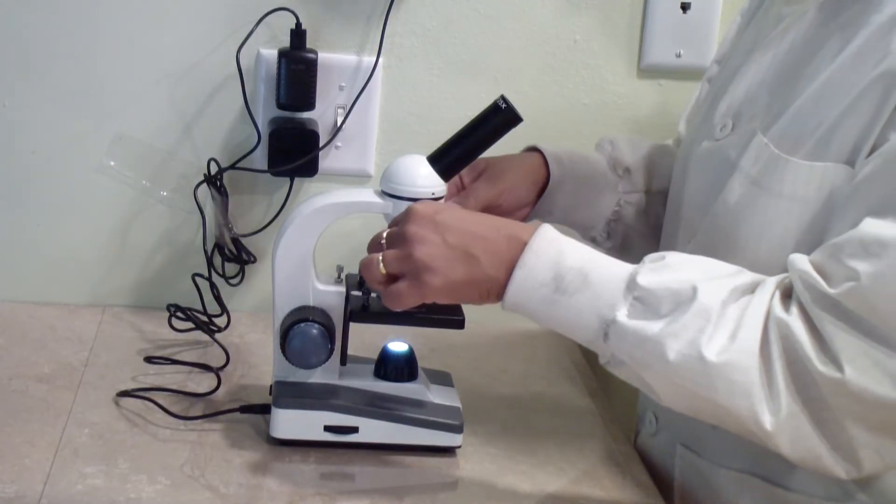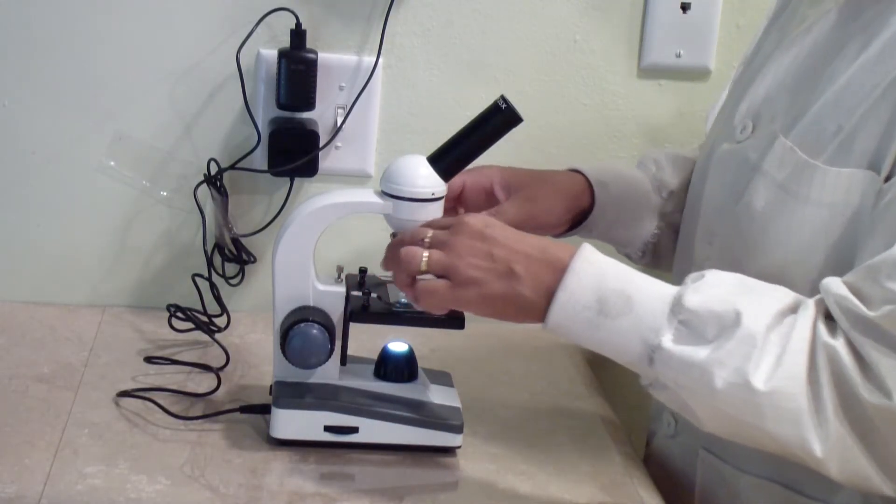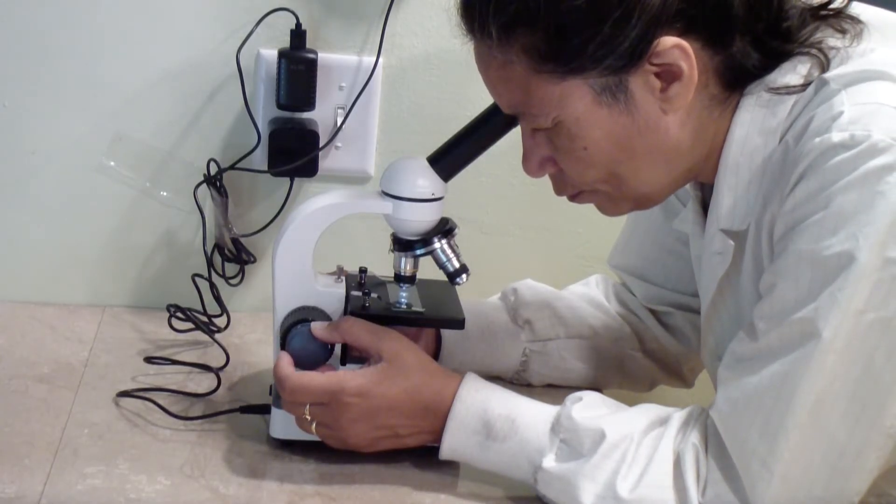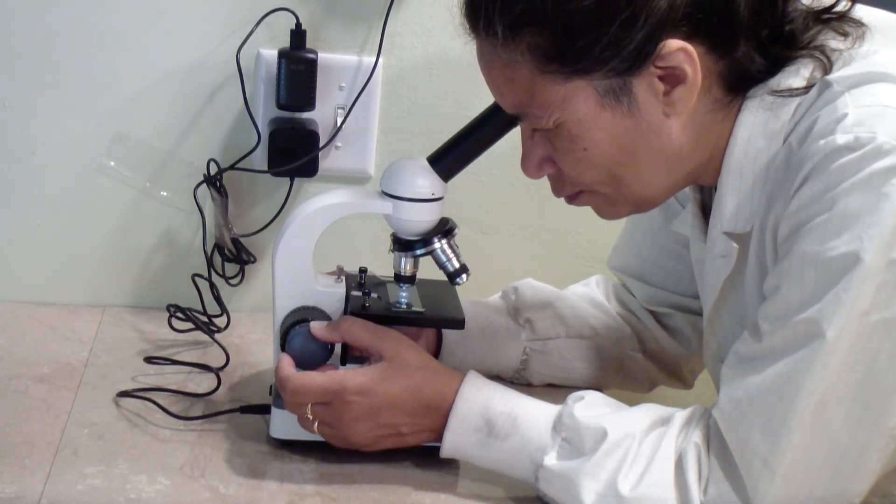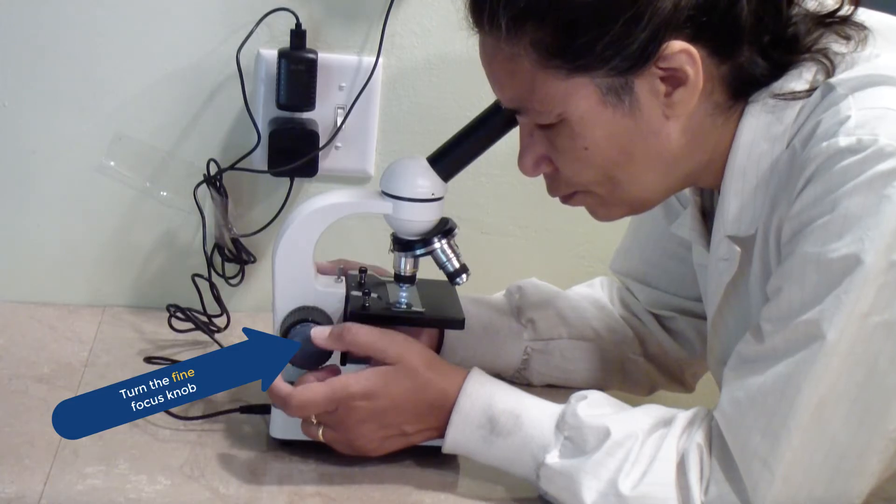Once your view is in focus, switch to the 10x objective lens. Look through the eyepiece and turn the fine focus knob until your image is sharp.